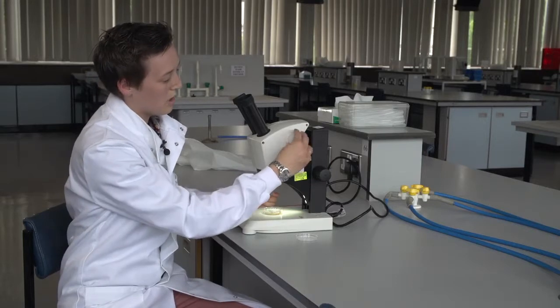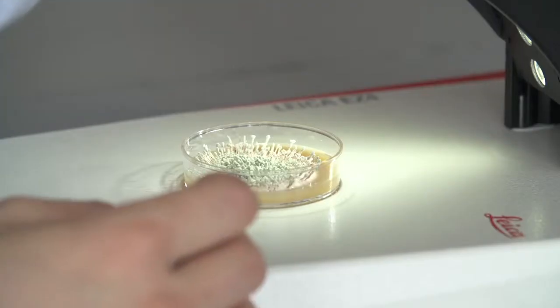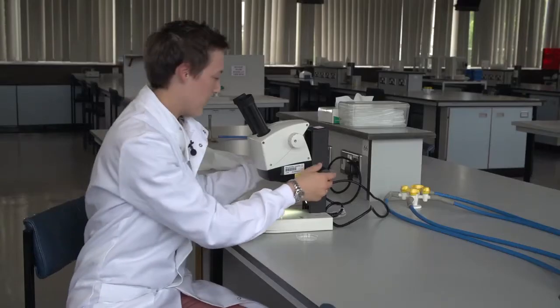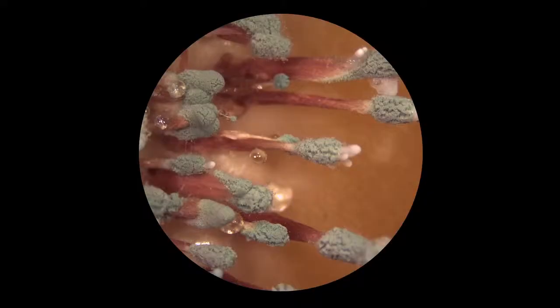I'm going to start at low magnification, same principles, start at low magnifications and work our way up. I'll then look down the eyepieces and find the focal plane that I want at this magnification.